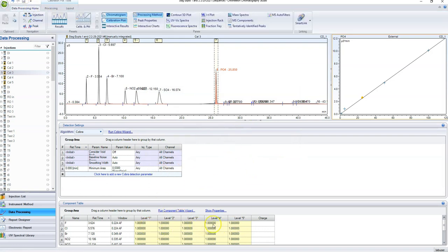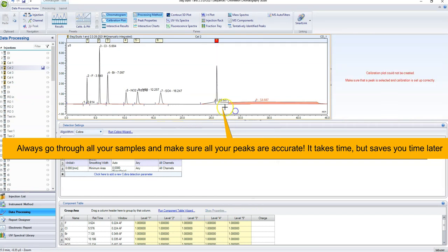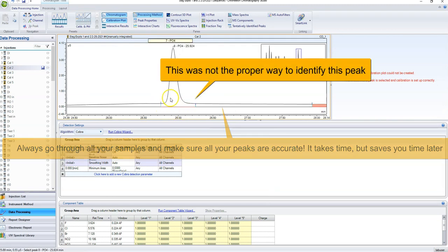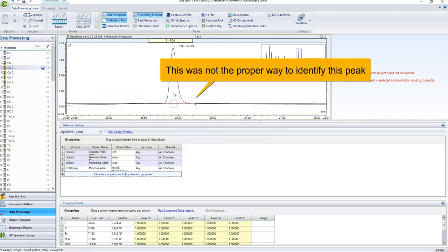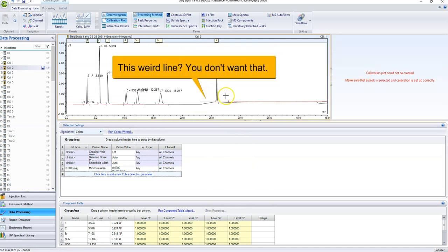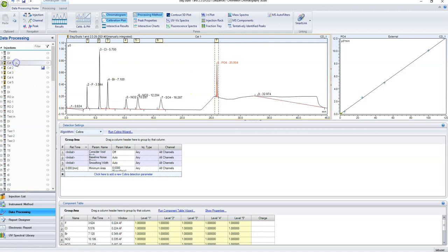Once you've got all of your values in here and you know that all of your calibration points are selected correctly, see, like this one still isn't. So I should have gone through all of these and made sure that they were all right. So this is how we do it. Loads of different little techniques that you can use. A lot of your skills are just going to come from messing around with it. You're going to have to play around in this software a lot before it actually all makes sense.